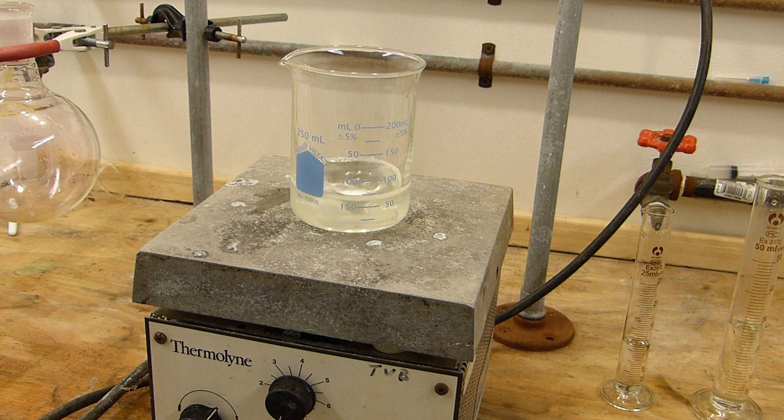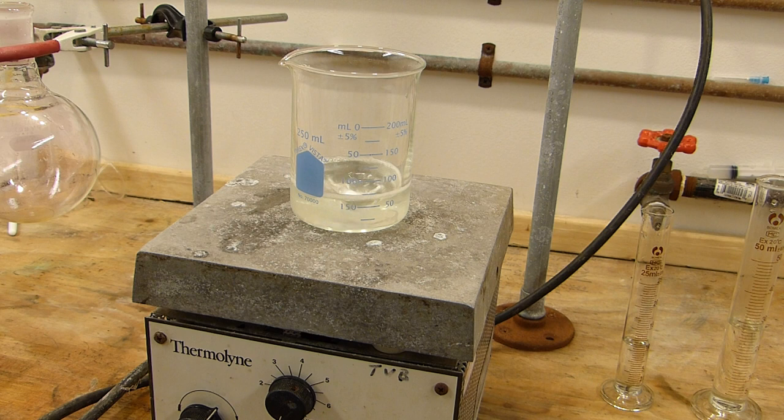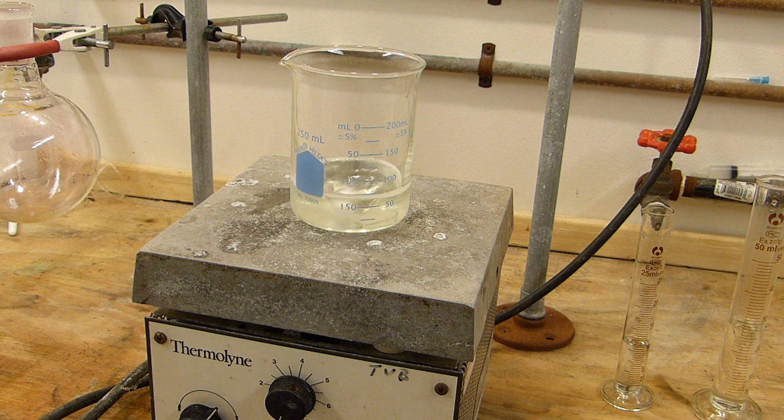While this is stirring it's a good idea to place some water in the refrigerator. Approximately 150 milliliters is what we'll need to wash the finished product, so I've gone ahead and done that already.